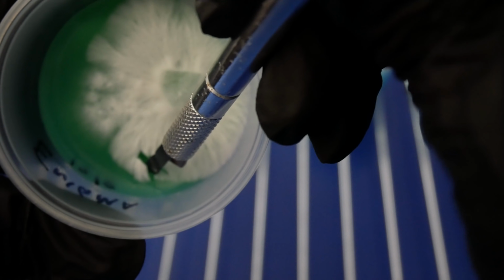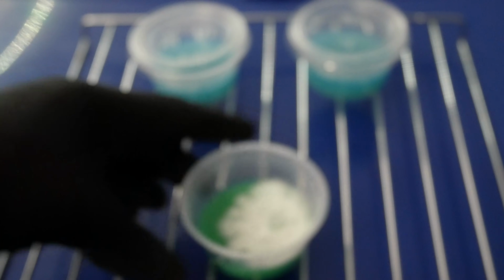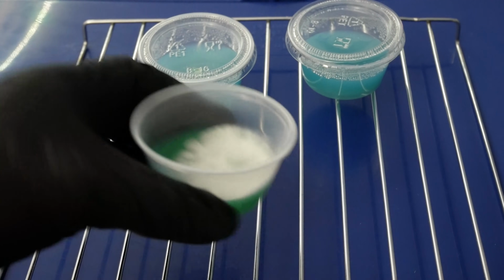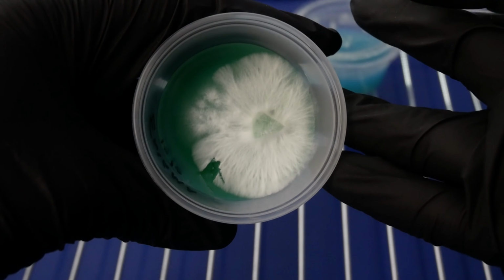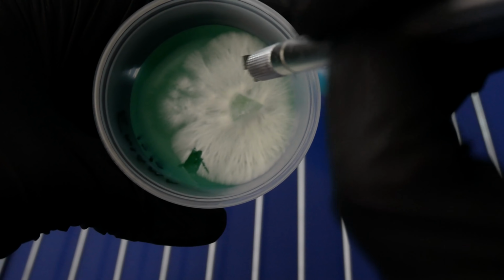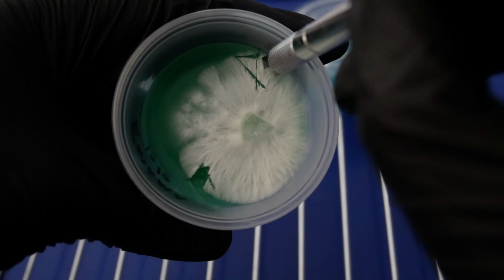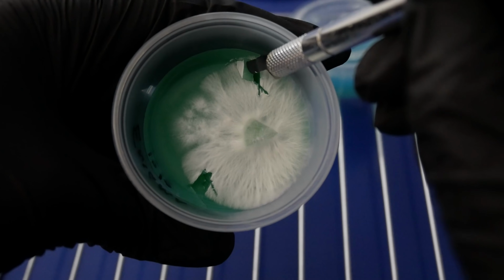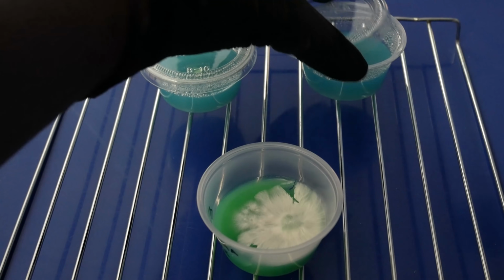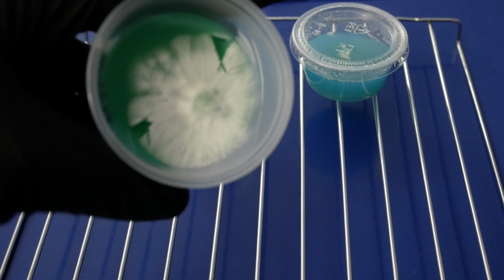So, make another transfer on the edge here. And I'm just looking for another sector to select some clean mycelium from. We'll go from the side opposite here. Pretty much it. Here, I'll let you guys take a look at the cup again.